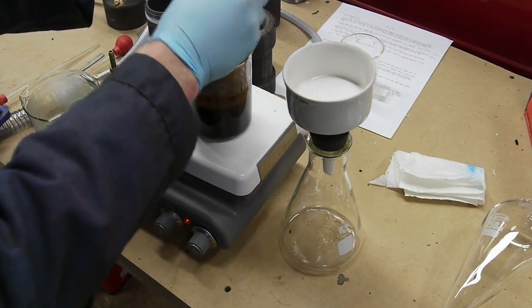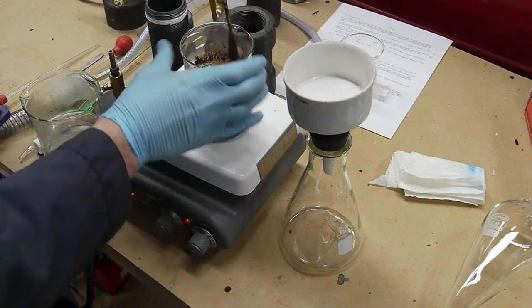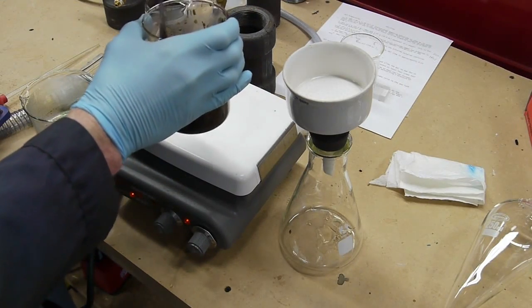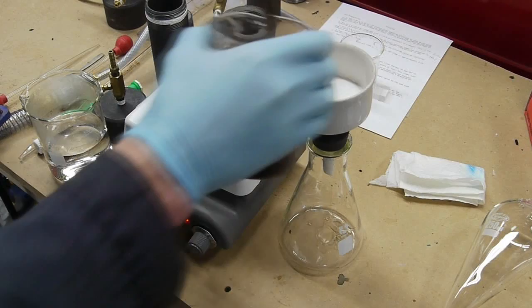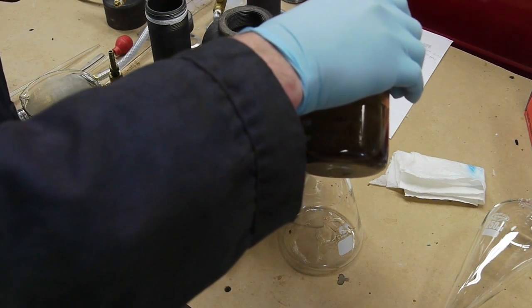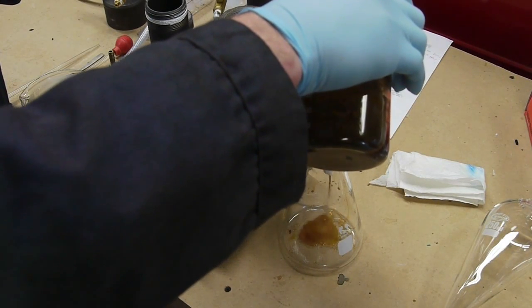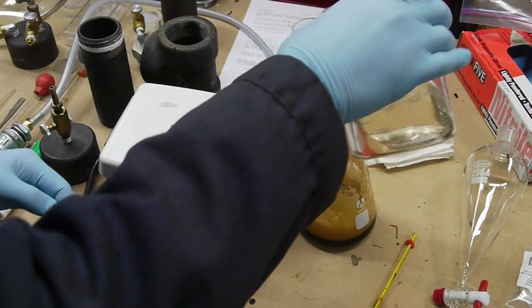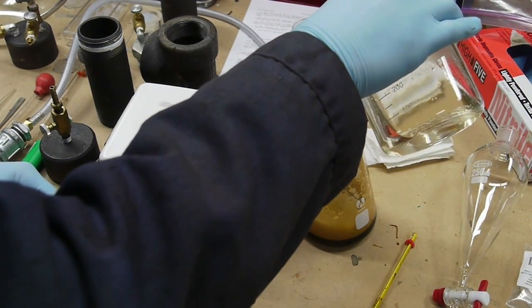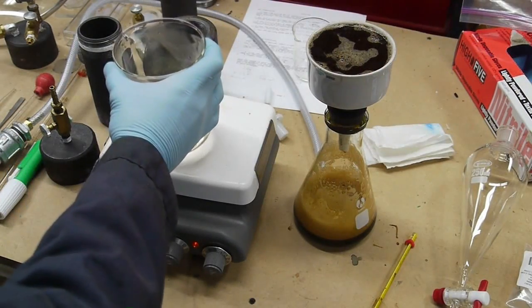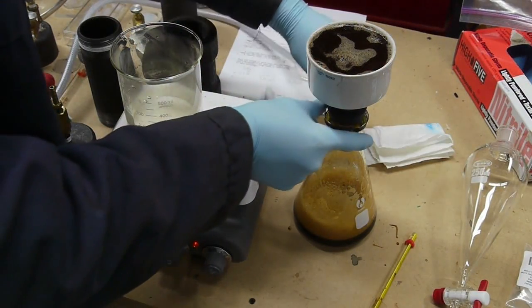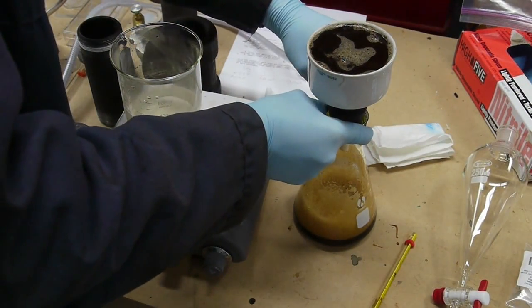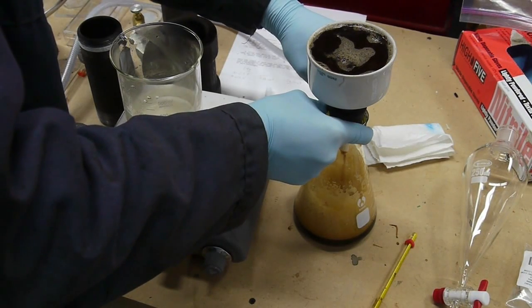I used the vacuum pump from my electron microscope - a Welch 1400 rotary pump - and started pumping the system down. What I would do is boil some extra water and then pour the water over the top of the coffee grounds to help wash more and more caffeine off of them. My separatory funnel can hold 250 milliliters, so my goal is to get about 200 milliliters of water through there.